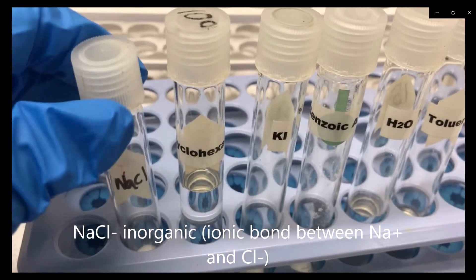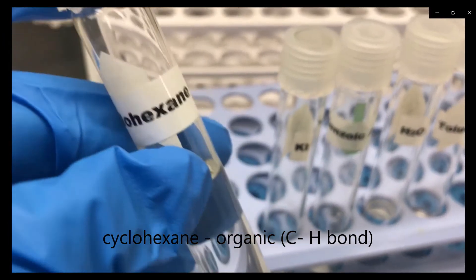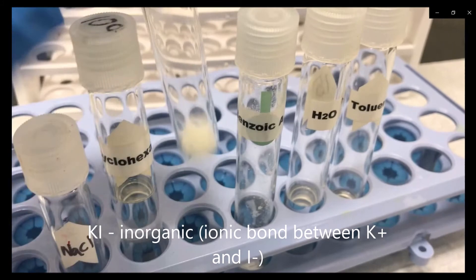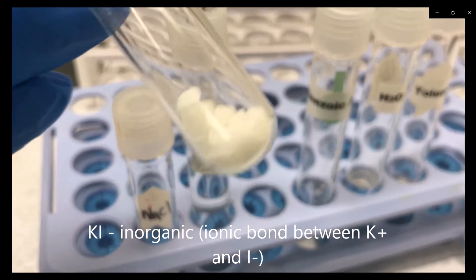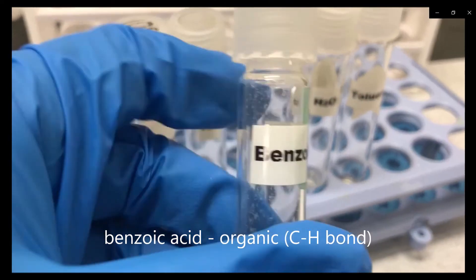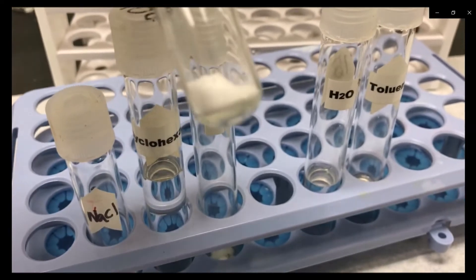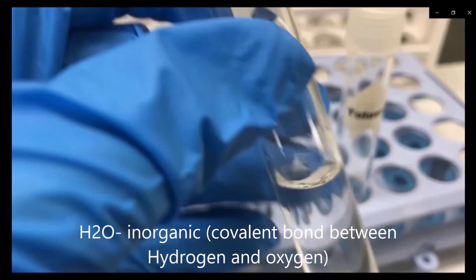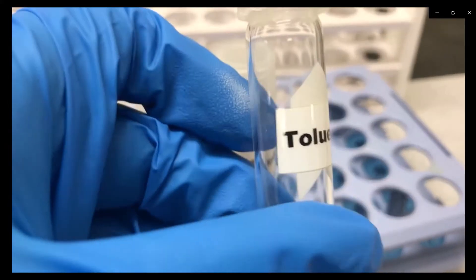Sodium chloride is a white crystalline salt. Cyclohexane is a colorless liquid with a peculiar odor. Potassium iodide is a white crystalline solid. Benzoic acid is a white crystalline solid. Water is a colorless, odorless liquid. Toluene is a colorless liquid with a peculiar odor.